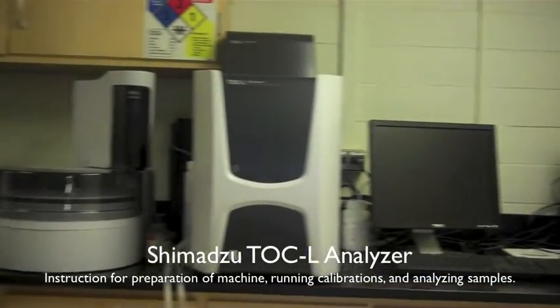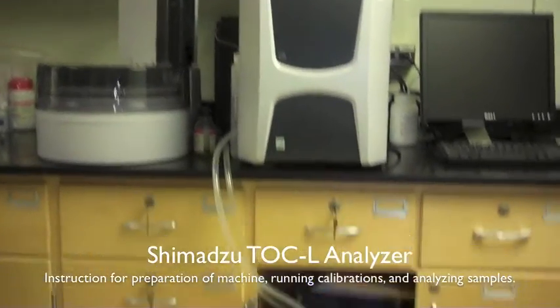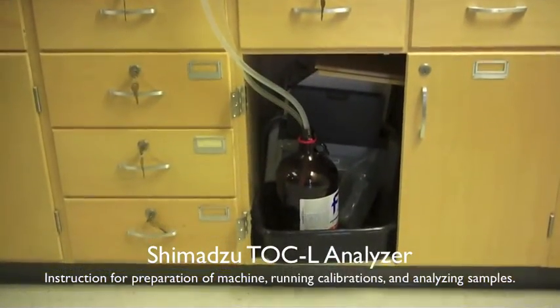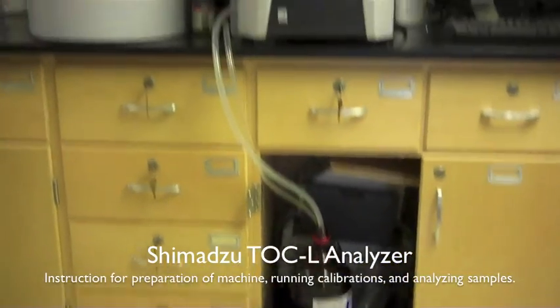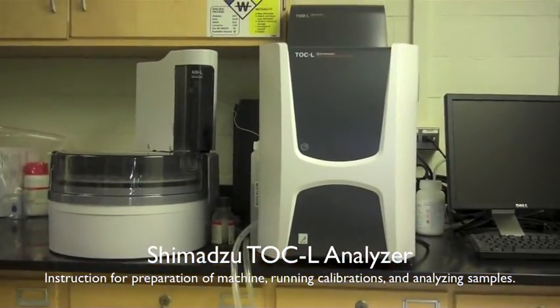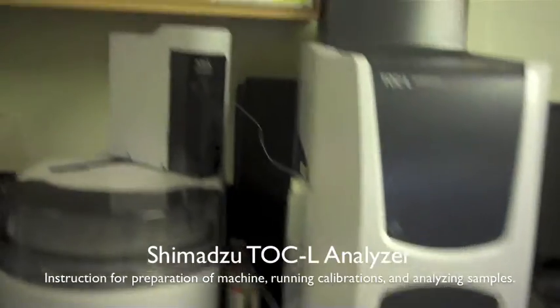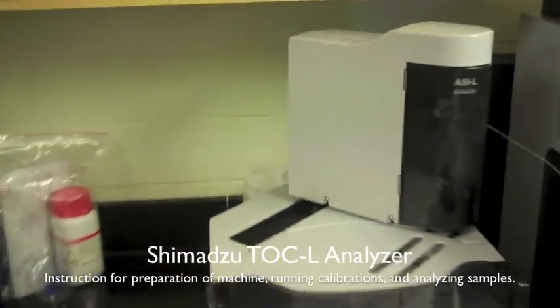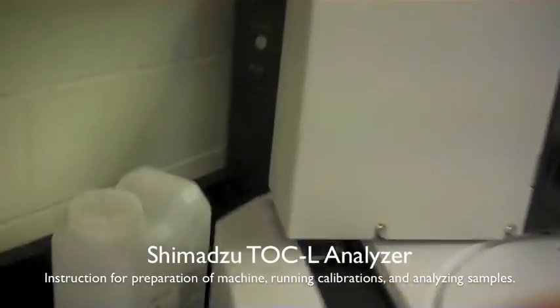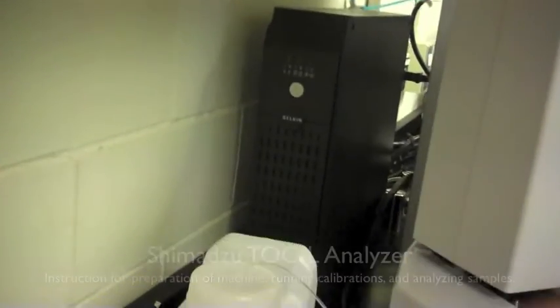The Shimadzu TOCL machine for total carbon, total organic carbon, total inorganic carbon, and total nitrogen analysis. These are instructions for preparation of the machine, running calibrations, and analyzing samples.